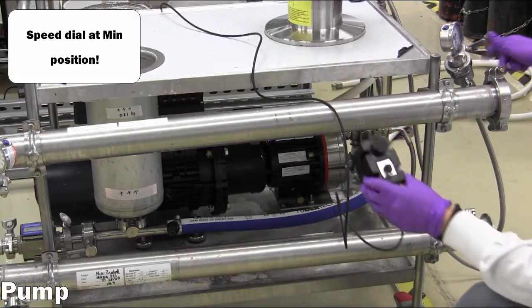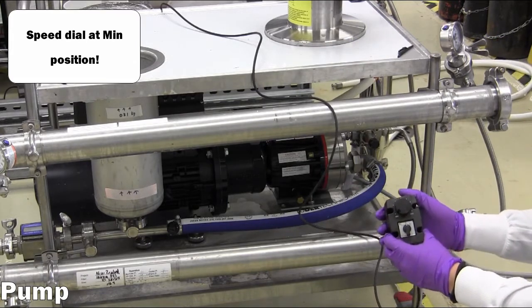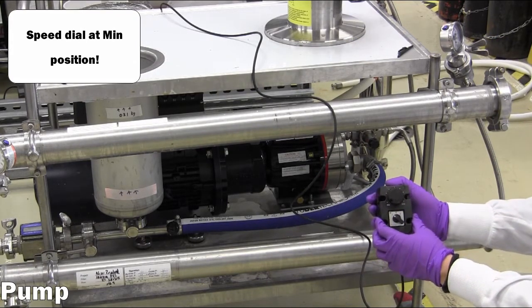The pump is then switched to the on position, and water will begin circulating and priming the membrane.